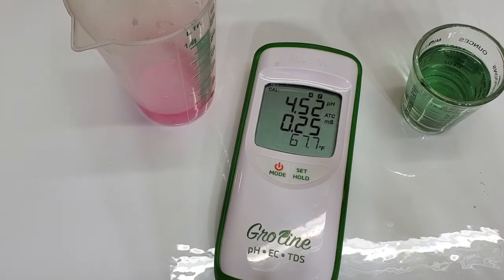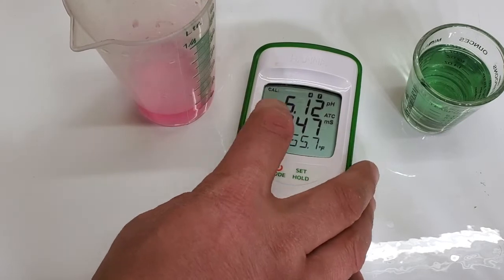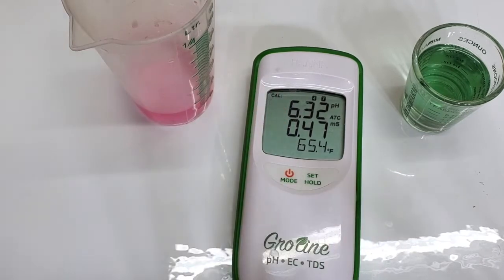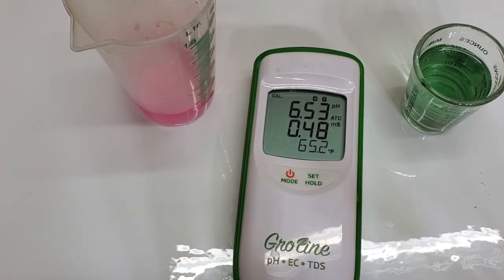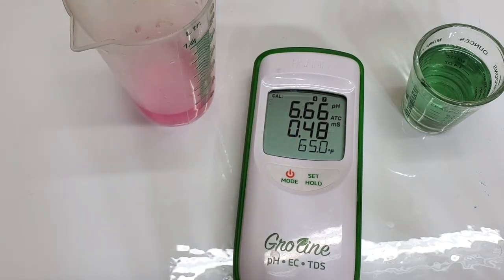Here's my city water, which will take time to temperature adjust, but you can see once it's calibrated it goes straight into ready-to-read mode. One thing about taking a reading on here — it's got this little timer that blinks that tells you to just wait. It's working on the accuracy. Getting the pH down to the hundredth takes time because pH is temperature dependent — it's going to wait for that temperature to stabilize before it tells you it's got an accurate reading.